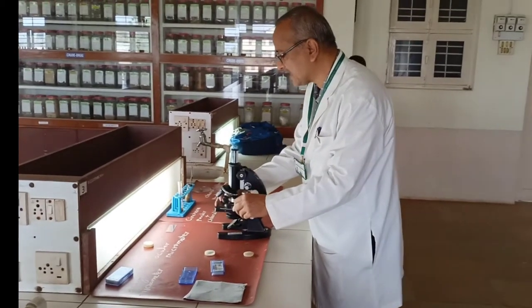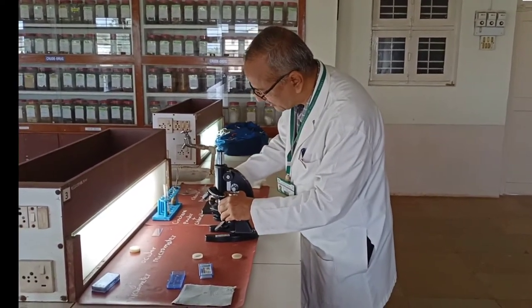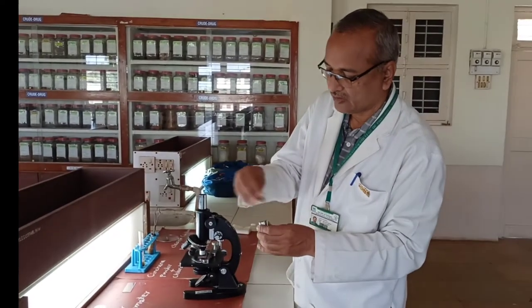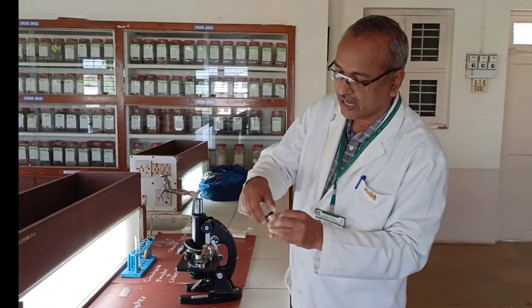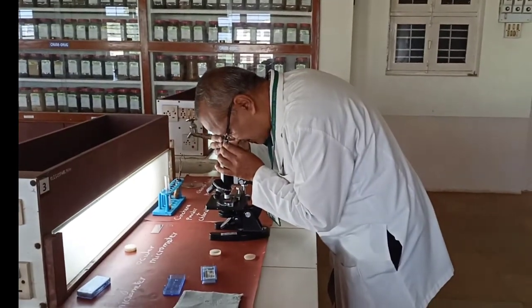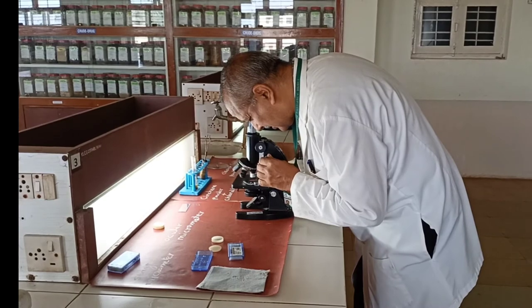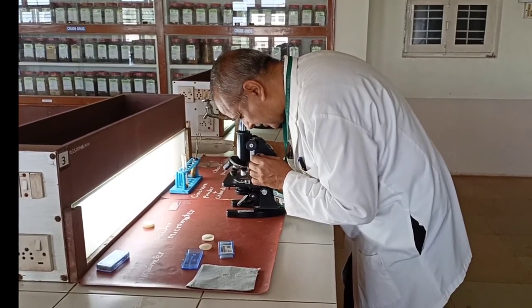The stage micrometer has 0 to 100 divisions and measures 1 mm; it is placed on the microscope stage. The ocular micrometer is to be kept in the eyepiece — open the eyepiece and insert the ocular micrometer, confirming that the numbers are properly oriented and not reversed. Then align the lines of the stage micrometer, adjust the stage and ocular micrometer, and identify the nearest coinciding division.